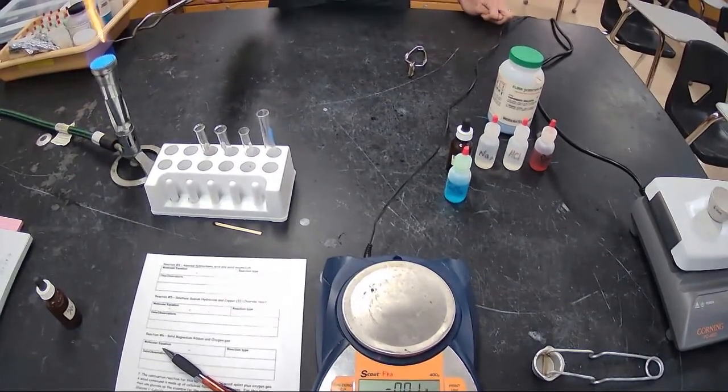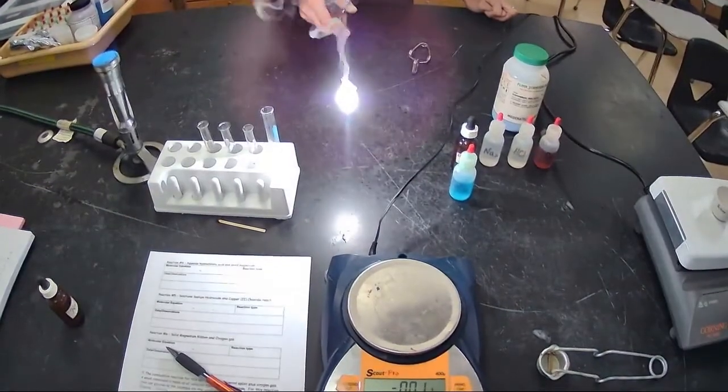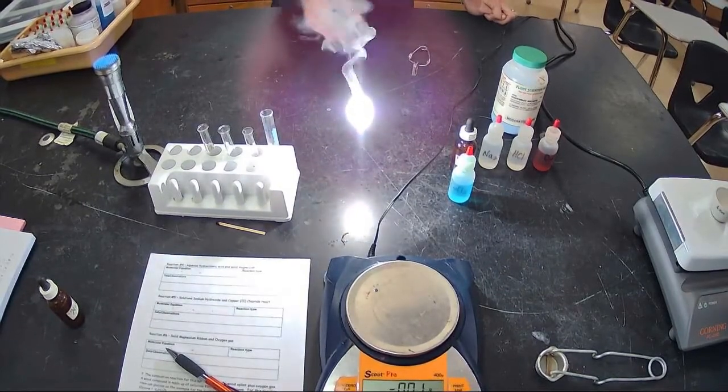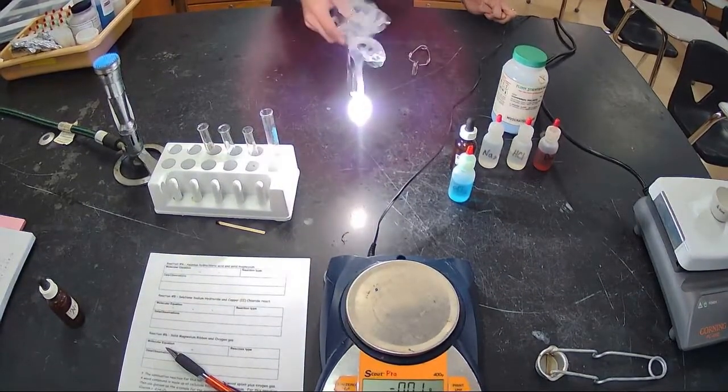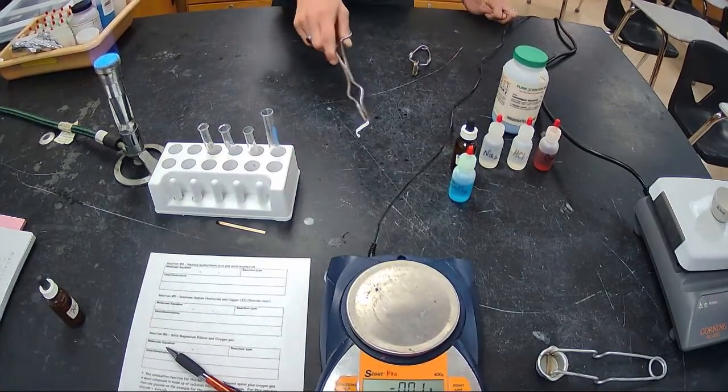So I'm going to just get it started. The moment I see a bright light, I'm going to look away. You can see how bright that is. I don't know if you can see how bright it is on screen, but our eyes can't stare right at it. I can see it easier on the screen than looking at it in real life because it burns out. Now look at the product.